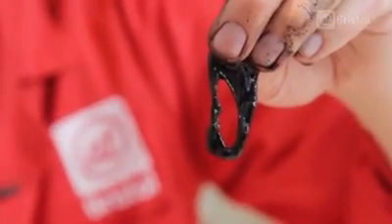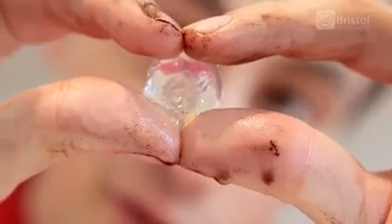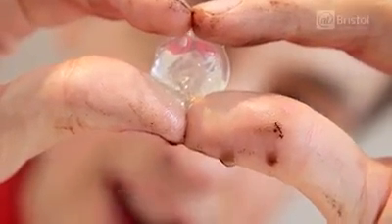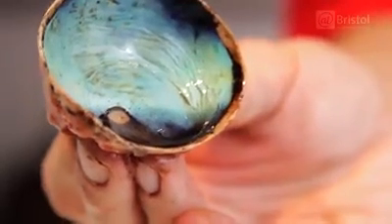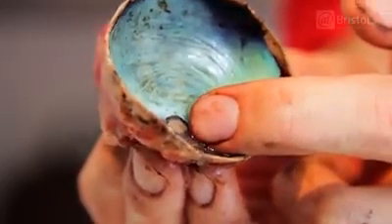But if you're in dark conditions, then it will open back up, meaning more light can enter. And this is the lens — it's what creates the image which falls onto the retina. It also allows you to focus on objects at different distances, so if you're looking at something far away or close up, it will change shape to allow the image to focus in the right way. So the lens focuses the light which falls onto the cells in the retina, sending the message down the optic nerve.